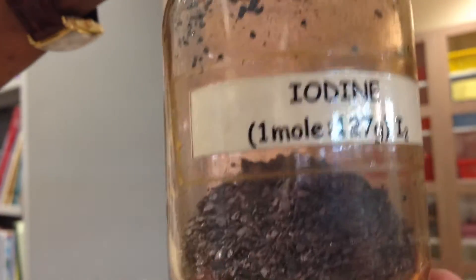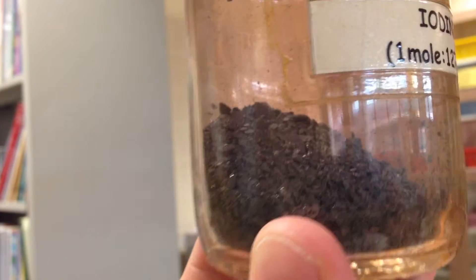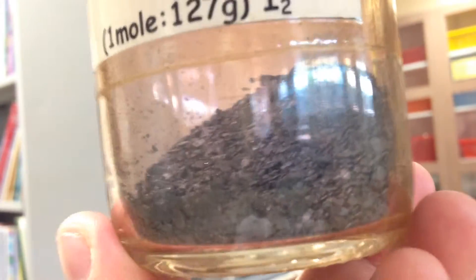At room temperature, iodine consists of purple crystals. It acts as a solid.